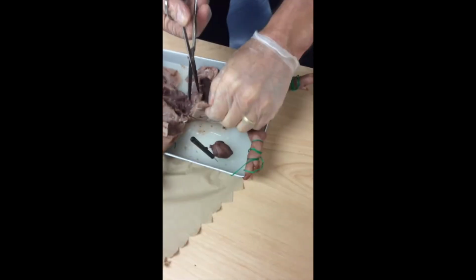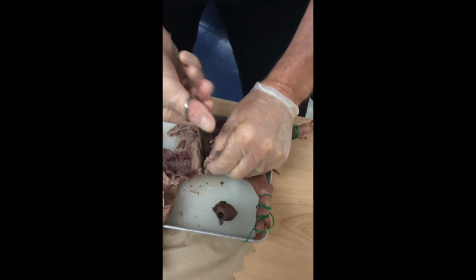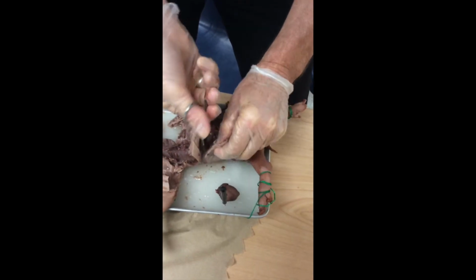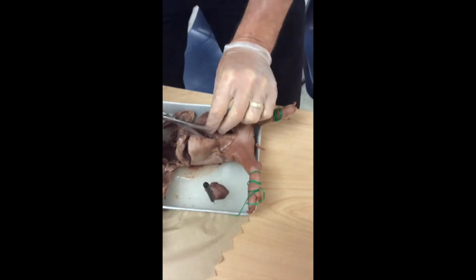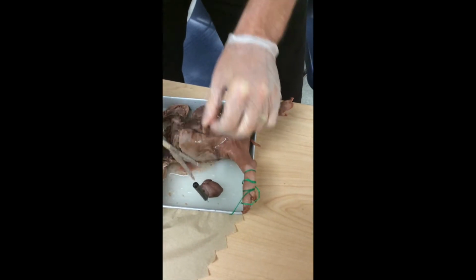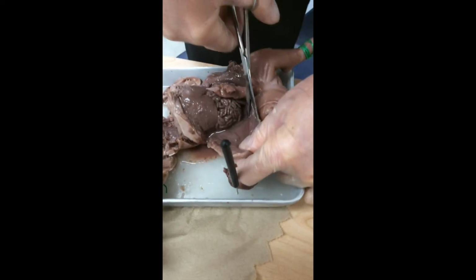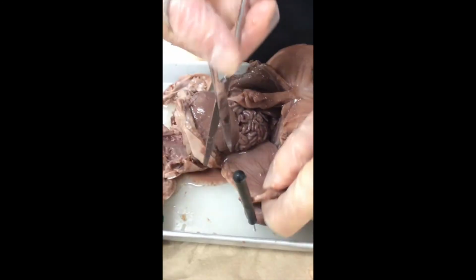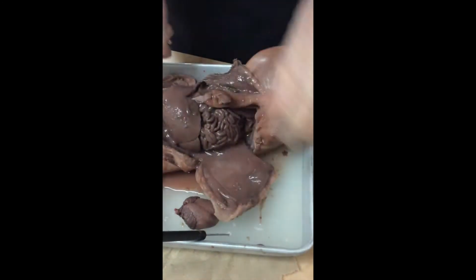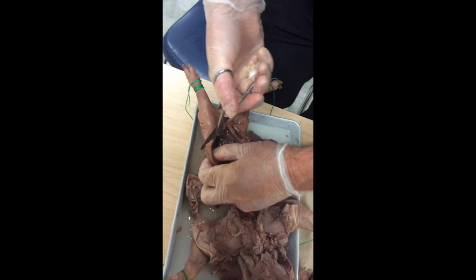I'm cutting on both sides on the back side of the diaphragm now, just peeling the walls down. It's a lot easier cut because we don't have ribs down here. I already removed the ribs. Starting to see some intestines there. Oh, that's good stuff. Getting that cut all the way to the bottom so that the fluids can drain a little bit.